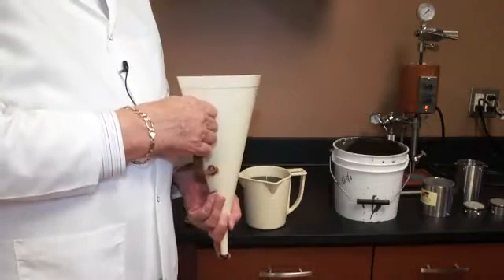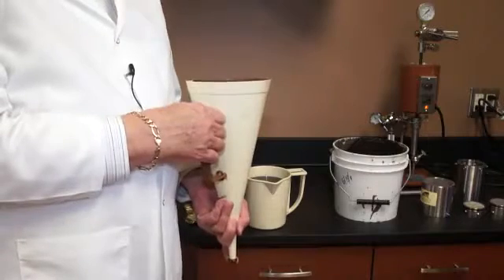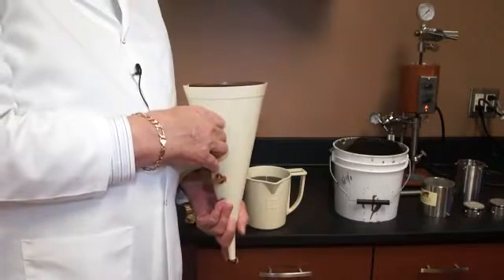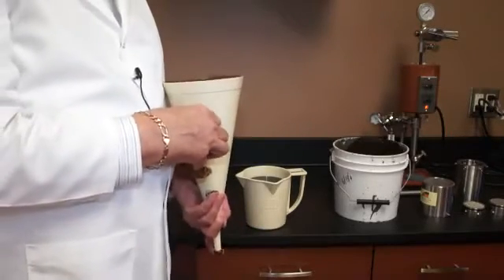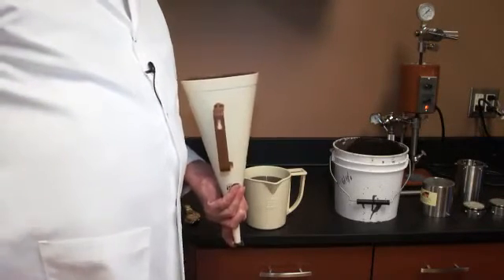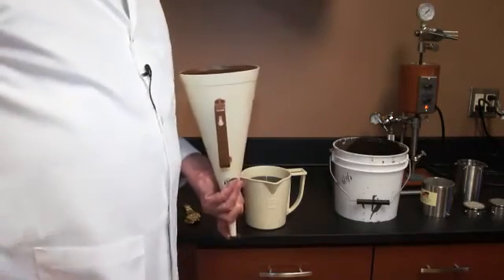If I rerun this test, as I said before, and I get 40 seconds and 50 seconds, and all of a sudden I get 90 seconds, or I get 30 seconds, something very out of the ordinary, then it's time to start adding sacked bentonite or lignosulfonate or something to the drilling mud to thicken it up or thin it out, whatever. So that basically is how you run a Marsh funnel viscometer test. It is very simple, very easy, and it works very well, and that's its beauty. It's a very simplistic piece of equipment. Thank you very much.